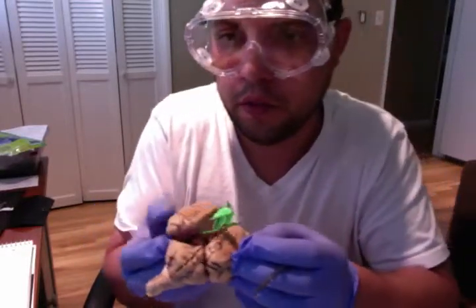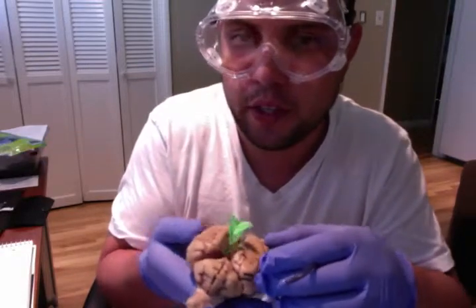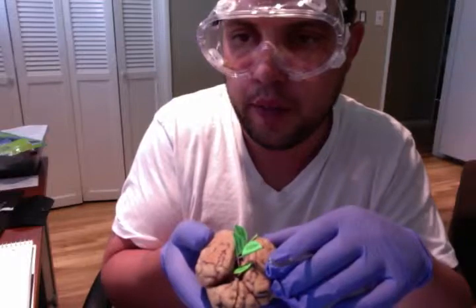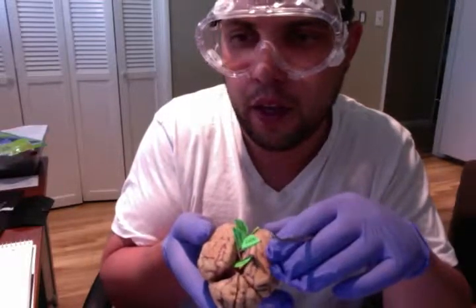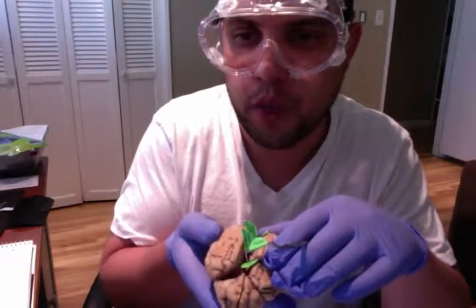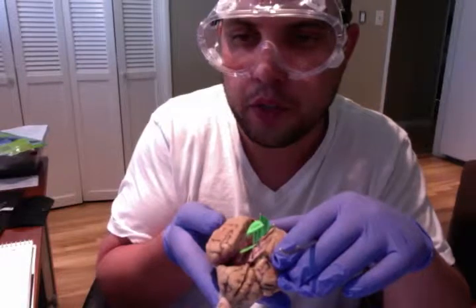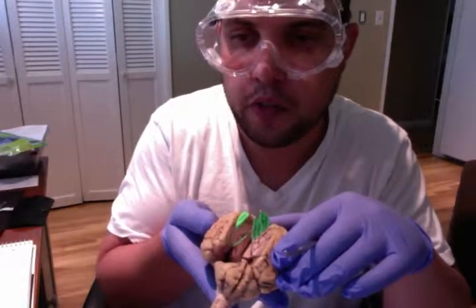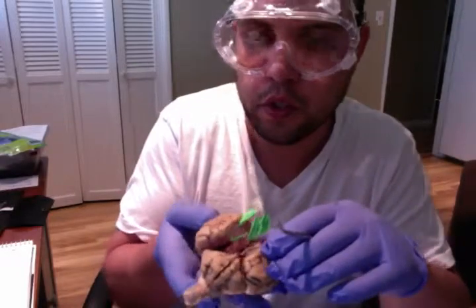Lateral ventricle. The ventricles produce and contain cerebrospinal fluid that bathes the brain and the spinal cord to provide protection, buoyancy, waste removal, and endocrine function. Each brain hemisphere contains a lateral ventricle, which converges into the third and fourth ventricles.